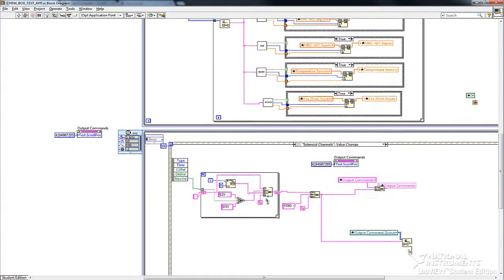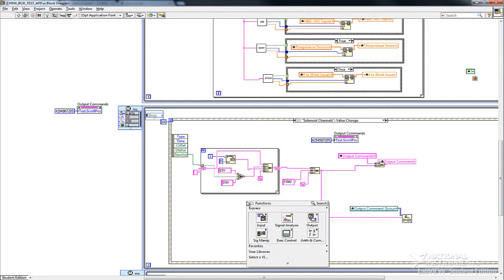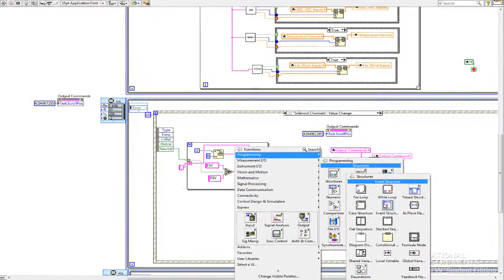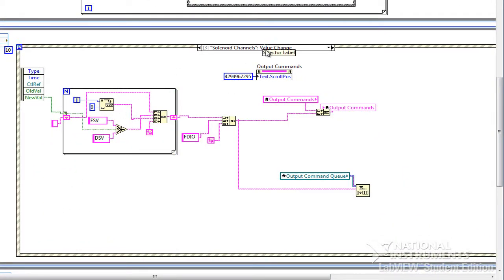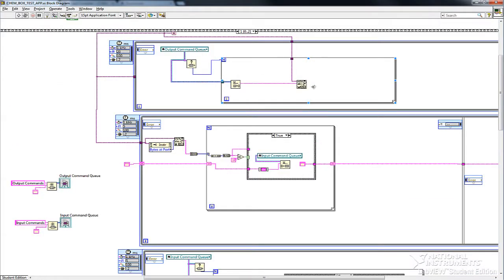Now what I do to command the unit is the opposite. I use this structure inside this while loop that scans for changes. In LabVIEW, I believe this is, right click here, programming, structures. This is an event structure that looks for changes in, for example, anytime I change the value on the solenoid channels. I write a little loop that builds up the necessary control strings, and then I dump it to an indicator on the front panel, and then I put it in the command queue. Then the other loop just dishes it out.